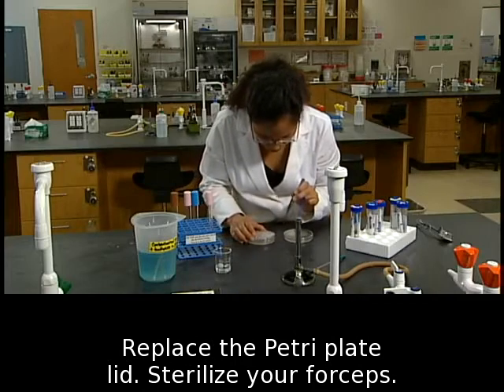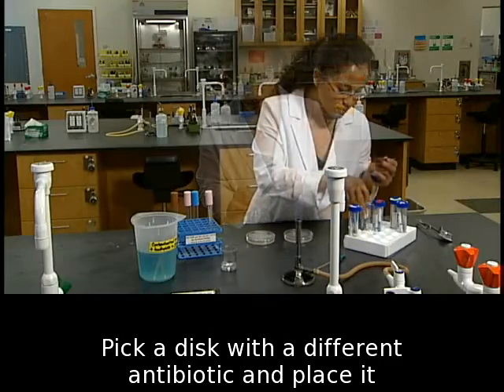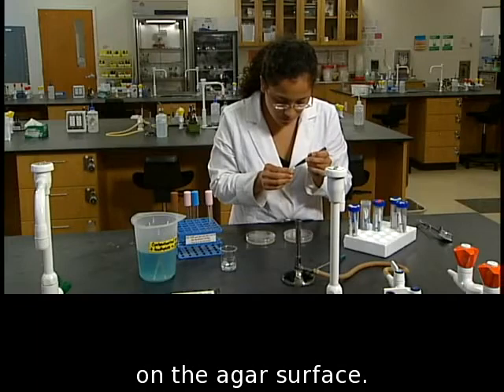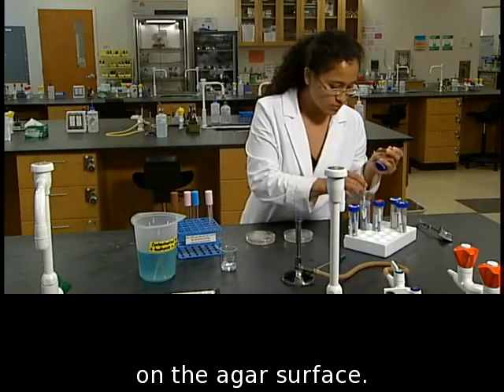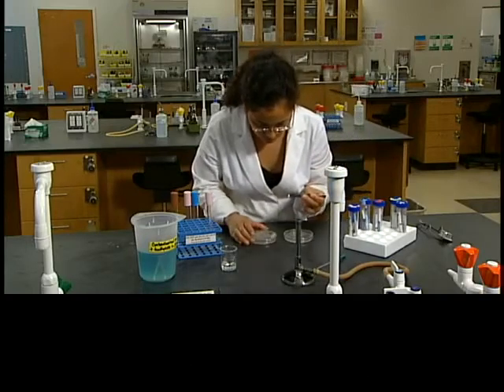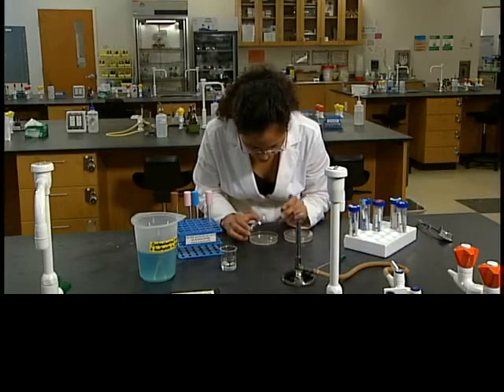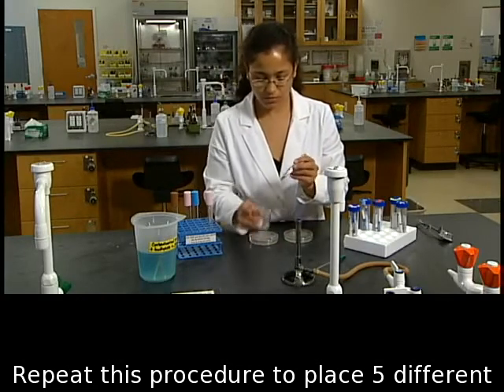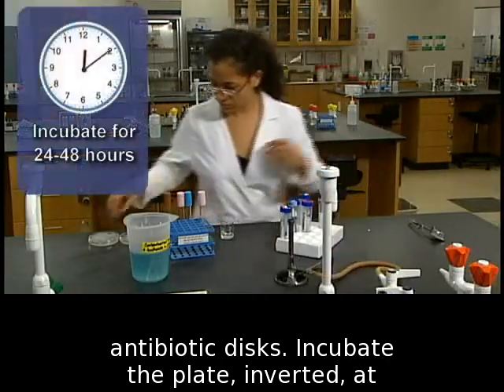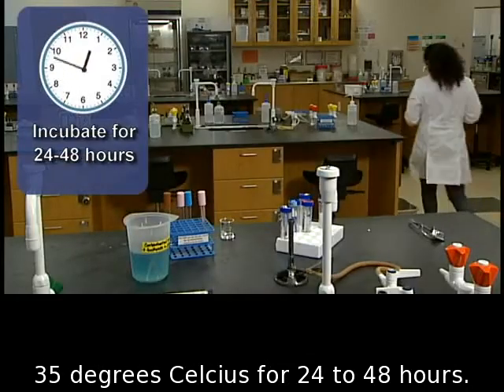Replace the Petri plate lid. Sterilize your forceps. Pick a disc with a different antibiotic and place it on the agar surface. Repeat this procedure to place 5 different antibiotic discs. Incubate the plate, inverted at 35 degrees Celsius for 24 to 48 hours.